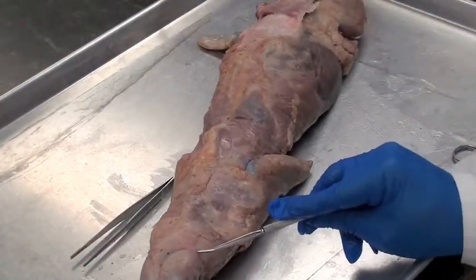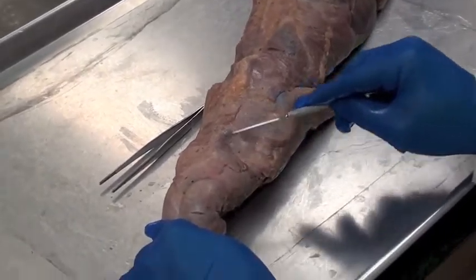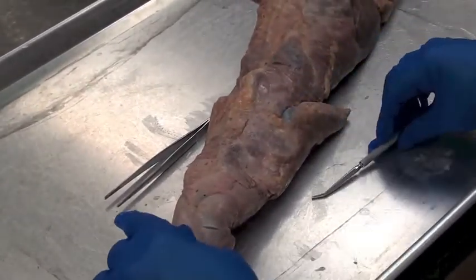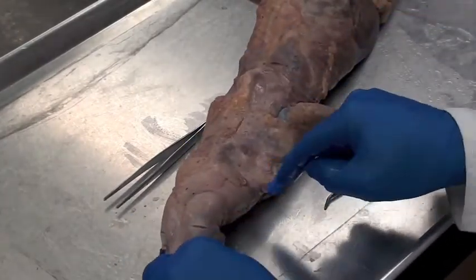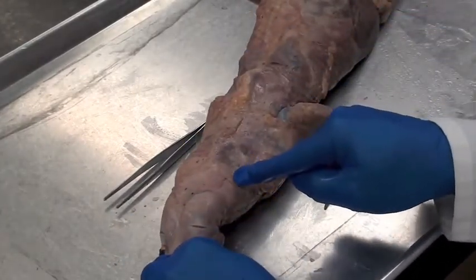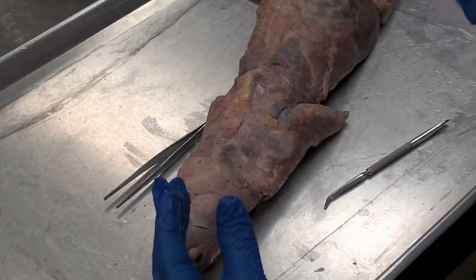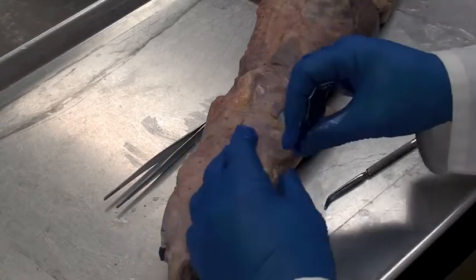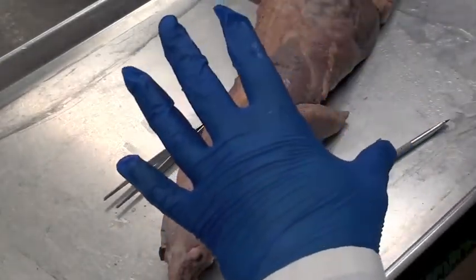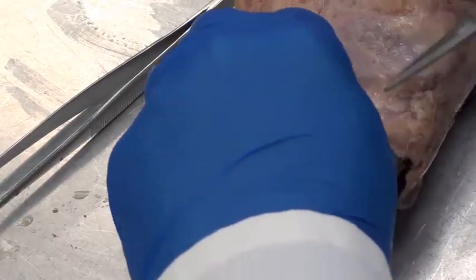Up in the mink's head, you see a very thin muscle cut along here. This is called the platysma muscle. In humans, we do have this muscle — found mostly on the front of our neck, it's a paper-thin muscle. When you contract this muscle, it tenses the skin on your neck, kind of making your neck stand out with that expression. In the mink, it makes the fur on its neck stand up a little bit more. So in humans and minks, a paper-thin muscle — and that's platysma.